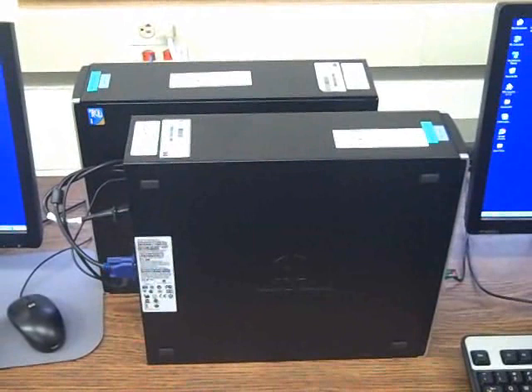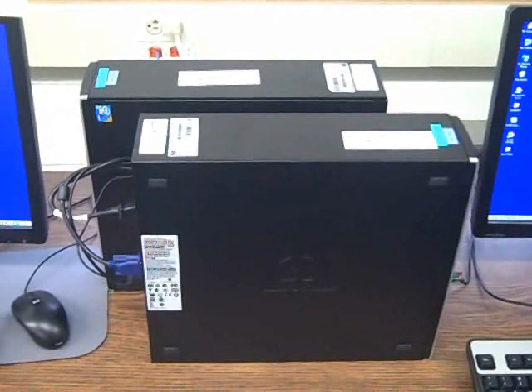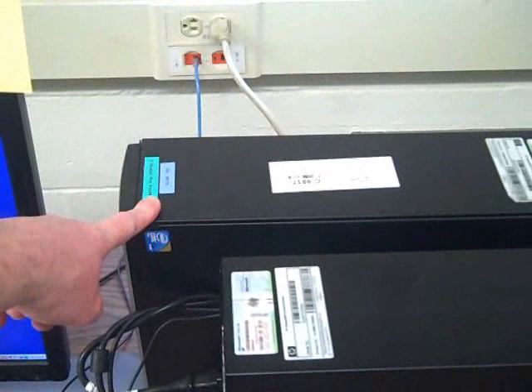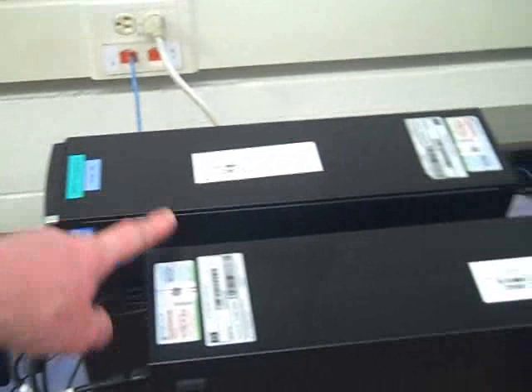Now what I've done is I have faced the two desktop towers right next to each other, sideways, so that we can actually see the cables coming out of the back and getting routed. In this case, the one in back is the one running E-prime, and it's the one out of which the parallel cable will run into the blue box. And this one is the one acquiring the physiological data, so this is the one where the blue USB cable will end up running into.